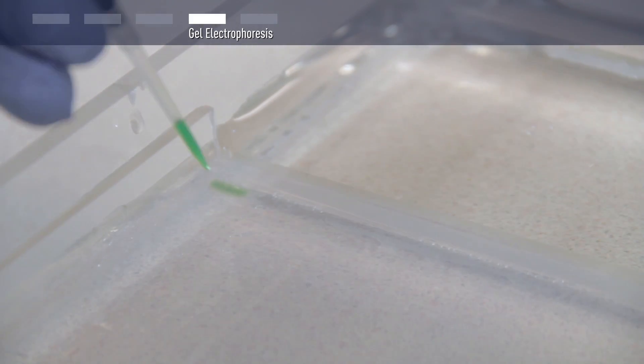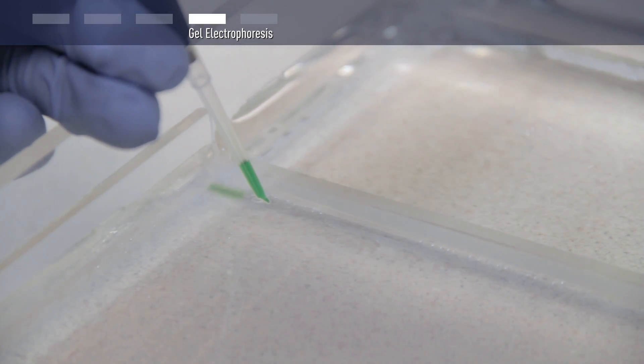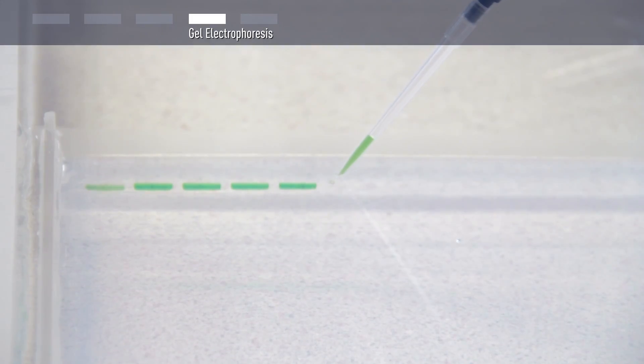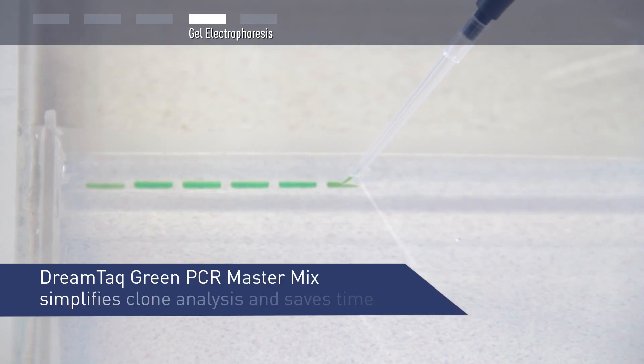When working with DreamTaq Green PCR MasterMix, it is not necessary to add loading dye into the reaction mixture prior to electrophoresis. This simplifies clone analysis and saves time.